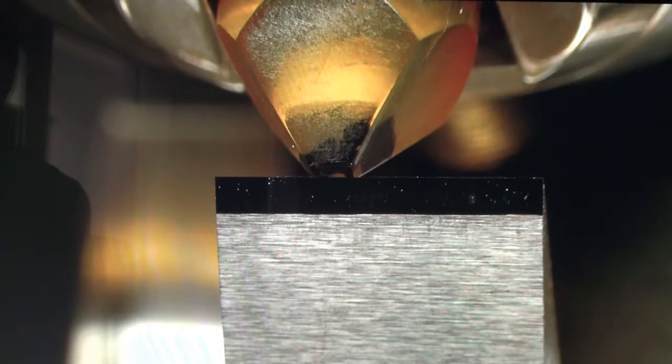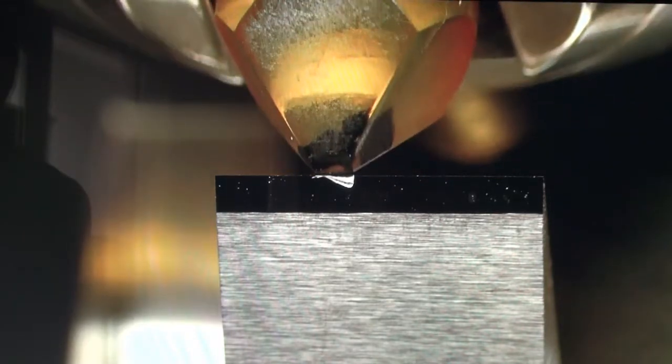Now as we approach this, the block face isn't nice and reflective, so I can't see a reflection of the knife to the block face. So I'm just taking a little bit of extra time. And I'm going to start facing that off and sectioning, advancing slightly. I always take a lot of little sections versus a few big ones.